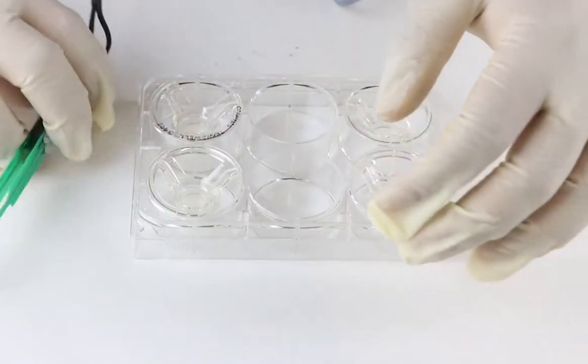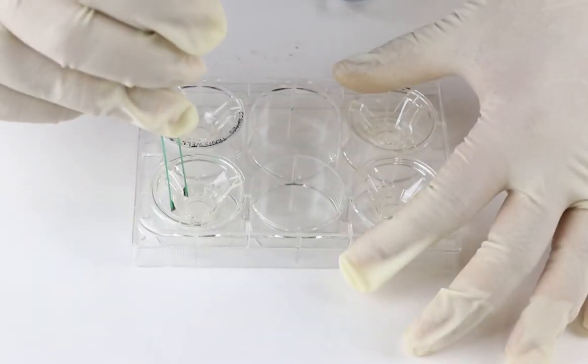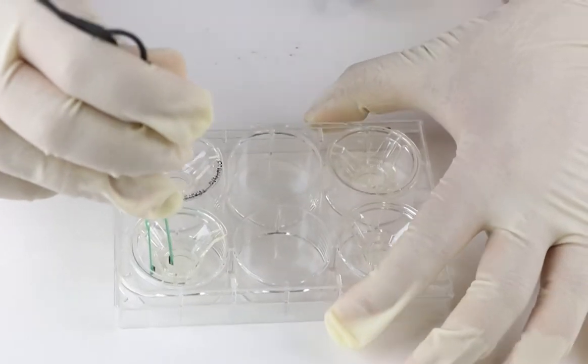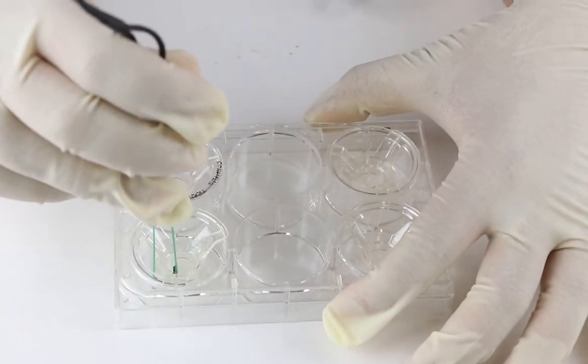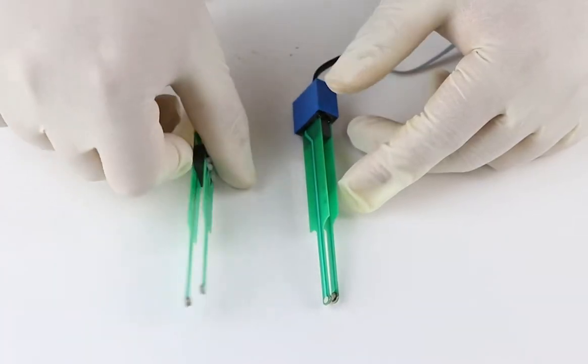The user has the option to adjust the length of the legs of the STX3 electrode so that the shorter leg will not come in contact with the membrane, in order to avoid damaging cells or damaging the membrane of the insert. Therefore, with Snapwell inserts, the STX3 electrode should be used instead of the STX2 electrode.